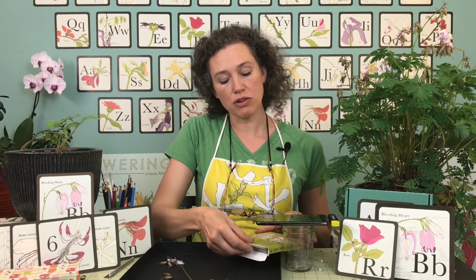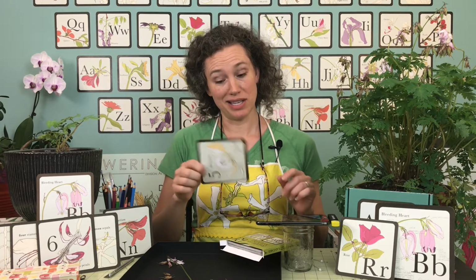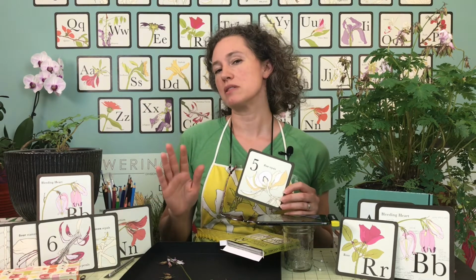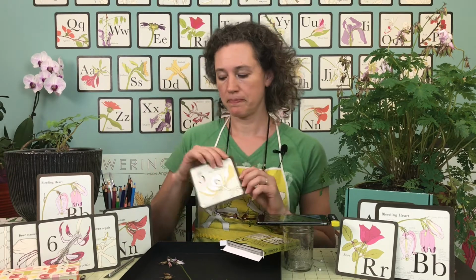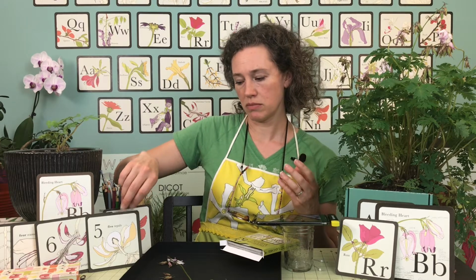But if it's not a eudicot, usually on monocots and on the Magnoliidae, obviously, since this is our magnolia, there are tepals. So if you can't tell the difference between the sepals and the petals, and they all look the same, like they do on this magnolia, then they're all called the tepals. Everyone is called a tepal.